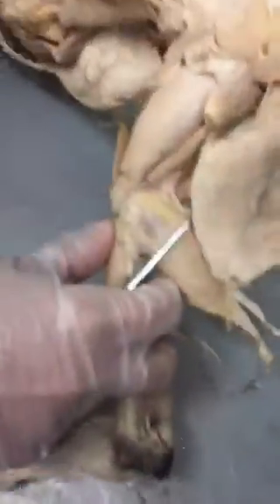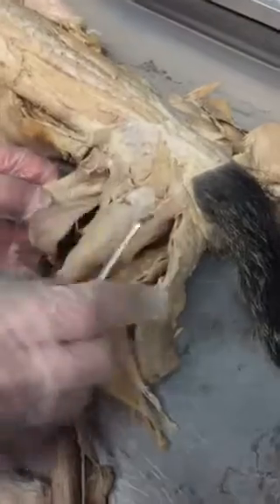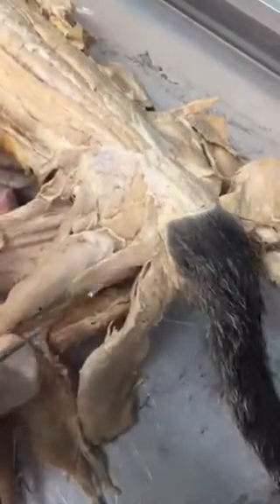Now I'm going to turn them over here. First, you have the gluteal muscles. It's not that clear in this one, I think. Oh, here we go. So you have gluteus medius first. In the middle, you have the gluteus maximus. And then the third strip is the caudofemoralis.